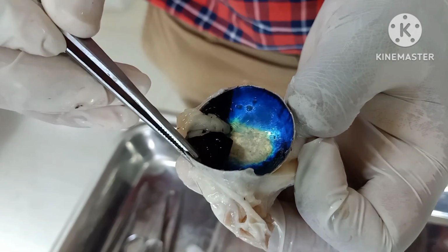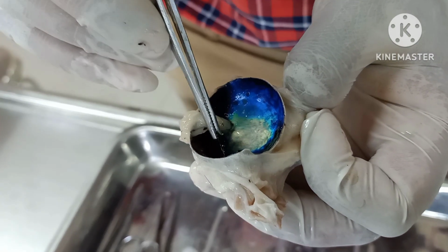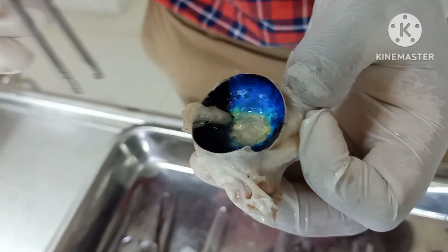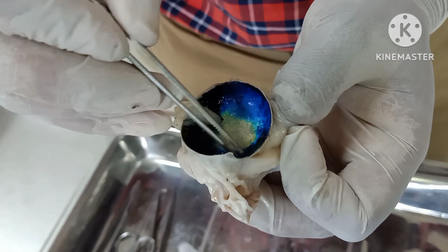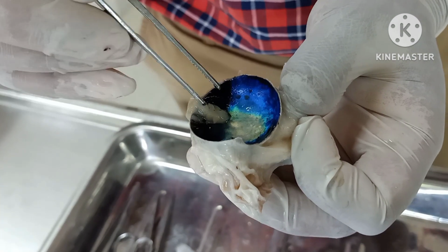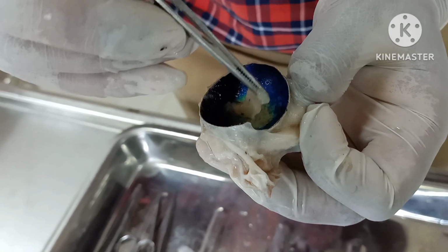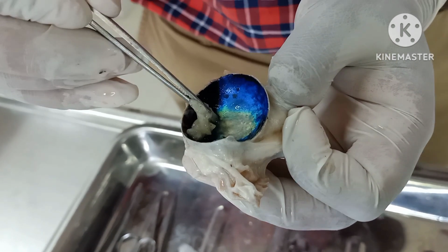So that is called the sclera. So outermost you are having the sclera, then the middle vascular coat called the choroid. As you move anteriorly, you will also see ciliary body and iris. Then what you are seeing here is the tapetum lucidum, this colored area. Then what is over it, that is the retina layer which we have reflected.